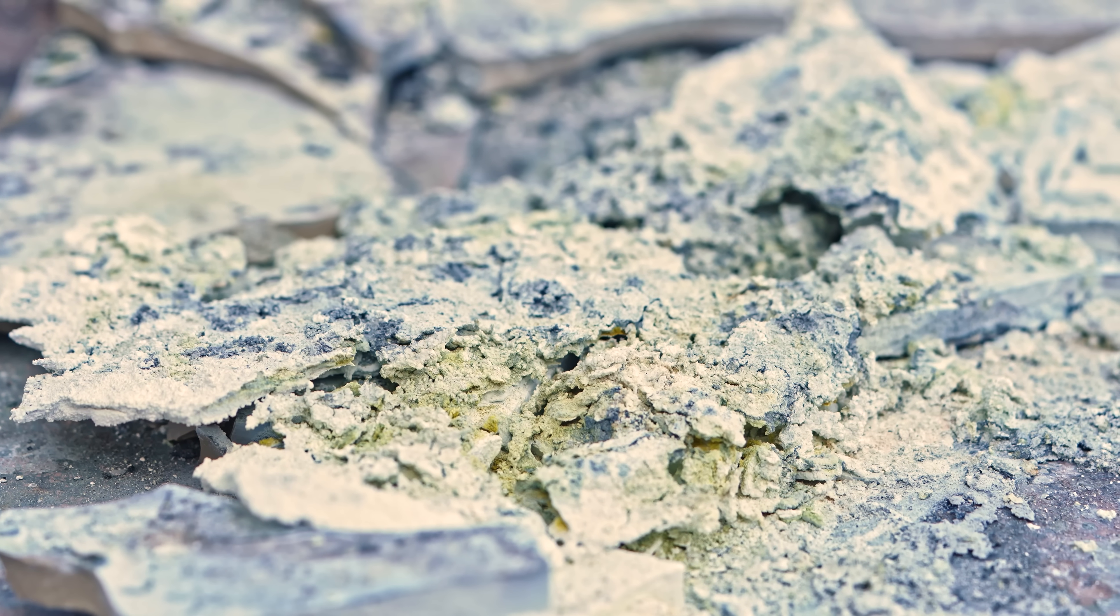After all, fire stopped. Looking at the burnt magnesium among the white magnesium oxide, we see a lot of yellow magnesium nitride.